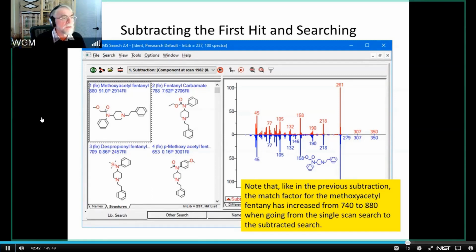a long time. This is sort of something that was back in the days before there was good chromatography. You did spectral subtraction a lot. Chromatography has gotten so good nowadays that you're not as used to doing it, but it's still useful for things that come out close together, or things that you're not sure are coming out close together. It's still a useful tool, and it's an easy tool to use within the framework of this database. And that's one of the reasons that I wanted to very briefly actually do the demonstration, and not just show you the slide, so that you saw that it was pretty easy.